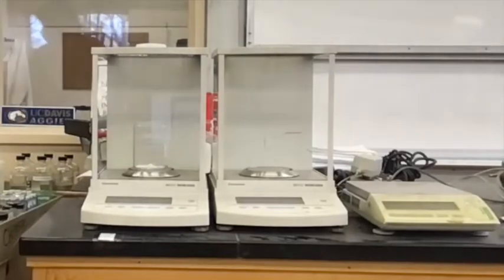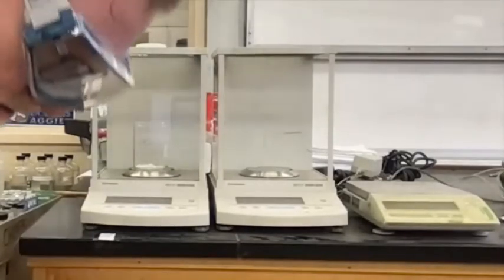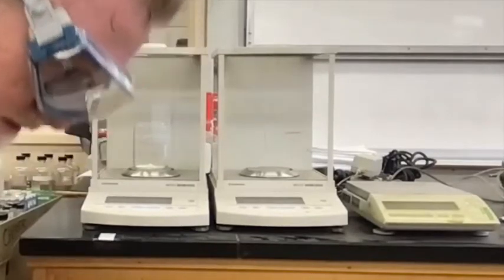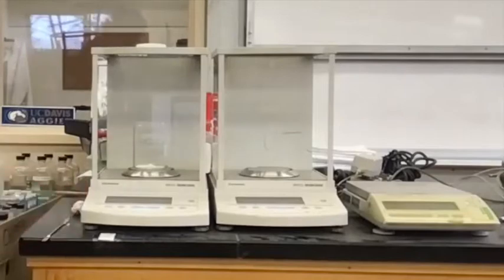I've got now my either acid or amine. I have about, oh look at that, 0.400. So not that, it's 0.4130 grams. Okay. Finally, I need to add my dibromobenzene, which unfortunately is in the stock room in the back, but I'll be back in 1 minute.